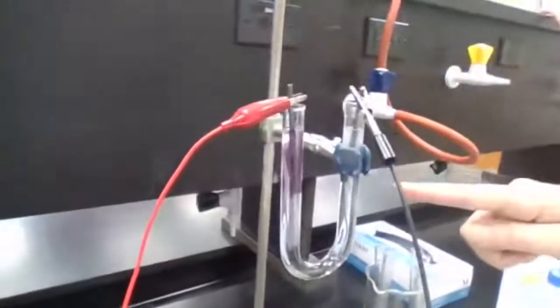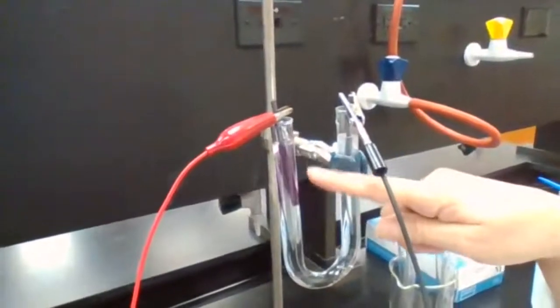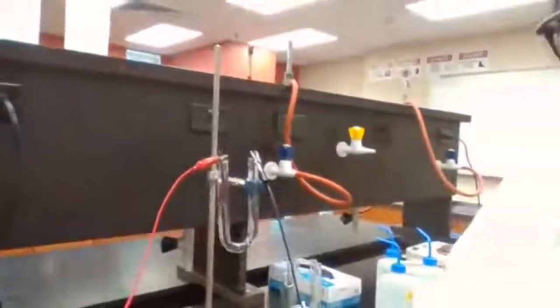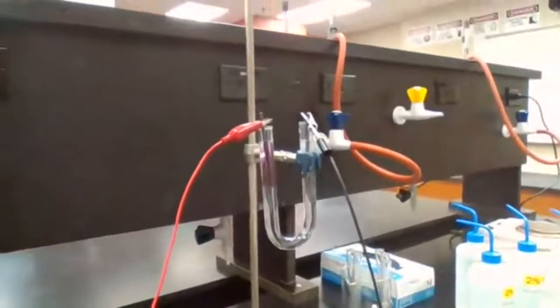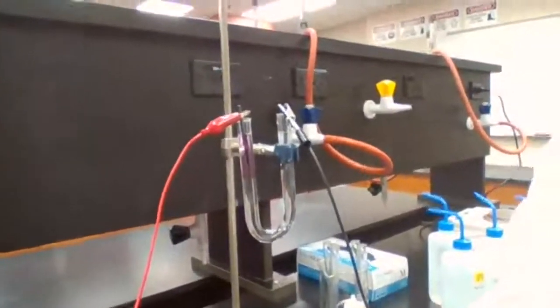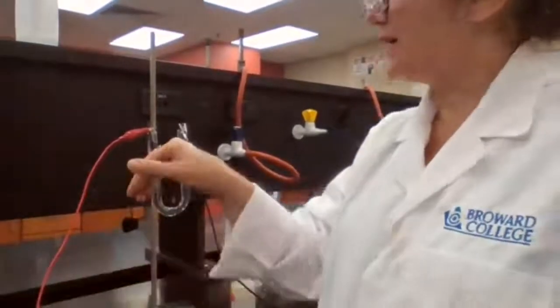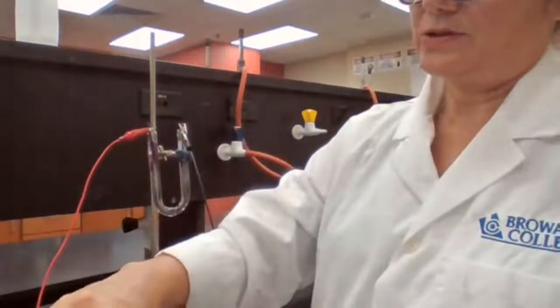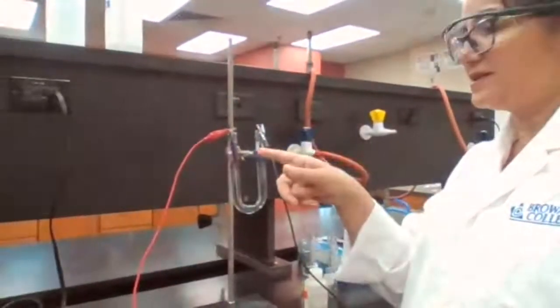Okay. See, the pink color appeared on the left side, on this side. So I know if the pink color appears, what does it mean? I explain more about the first experiment, then I expect you to think about the other experiments. When the pink color appears, that means hydroxide ion has been produced. So I go back to the lab manual and ask, what does it mean hydroxide ion has been produced? That means that water has gained electrons and produced hydroxide ion. So water is reduced.